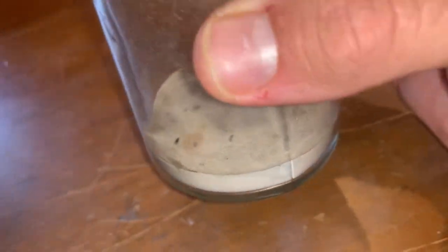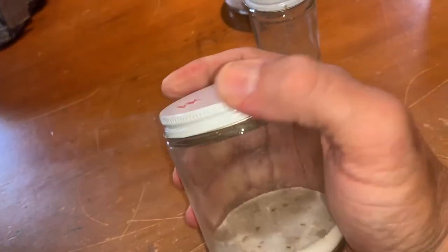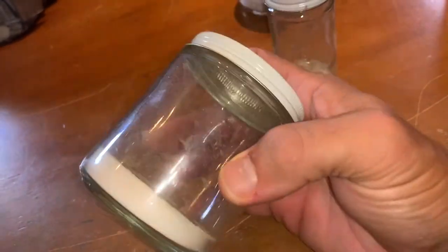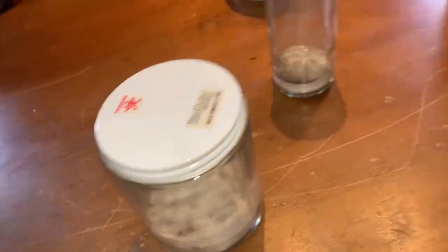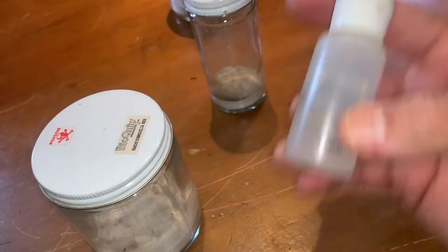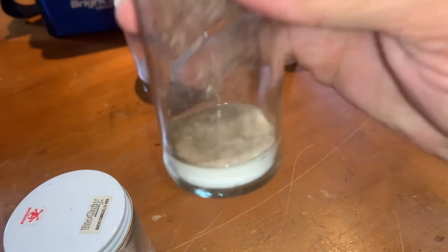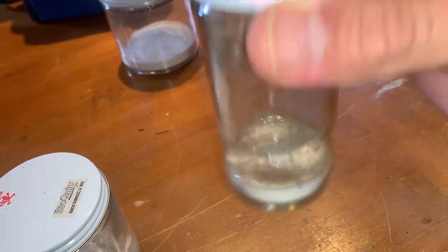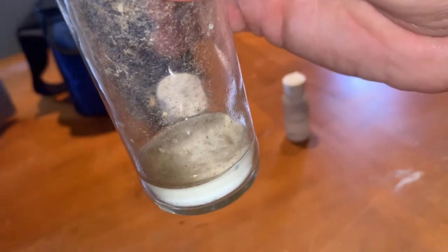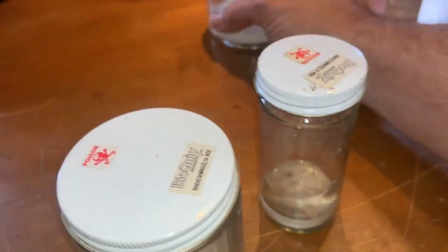The plaster holds enough of that gas inside its pores to operate well. If I keep the lid closed tightly, it should operate for quite a while — I've probably opened it a dozen times before I'd need to recharge with ethyl acetate. As you can see in my little jar here, it doesn't take nearly as much — I've emptied the extra in and let it charge.